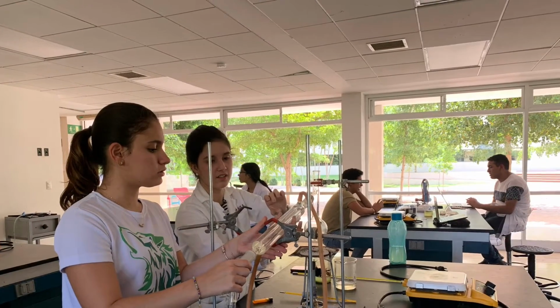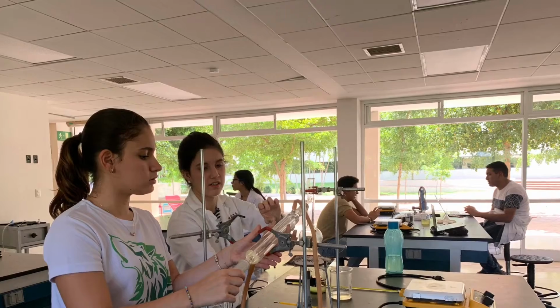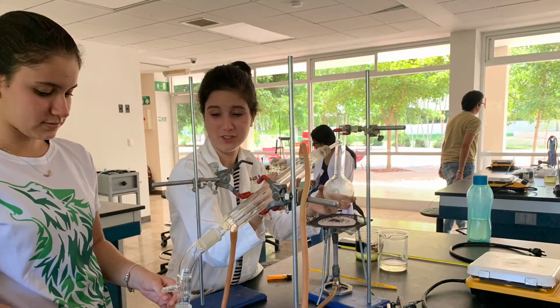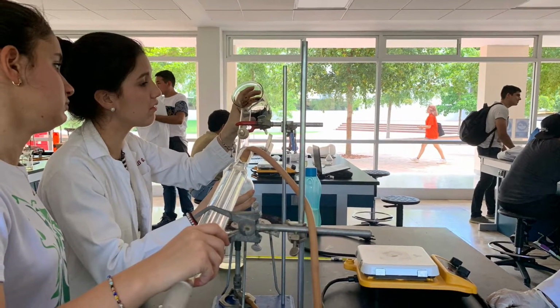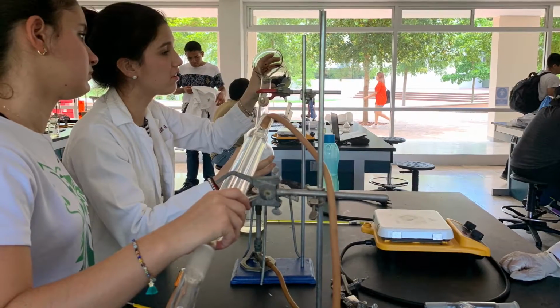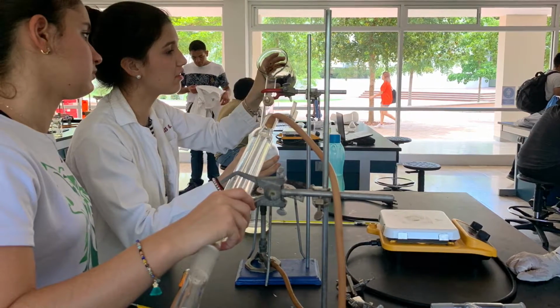The first system we made was the distillation system. We thought that with it we would be able to evaporate the water and then condense it, and with that separate water from oil, which was a hypothetical solution because it cannot be used in the river, but it can be used on a small scale.